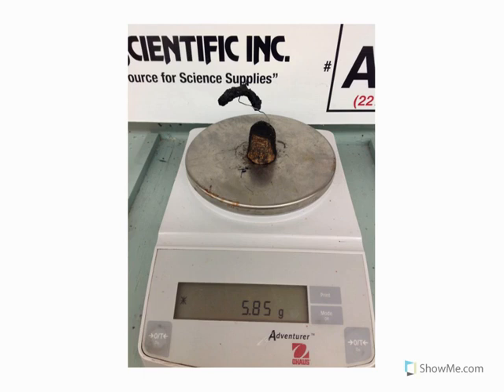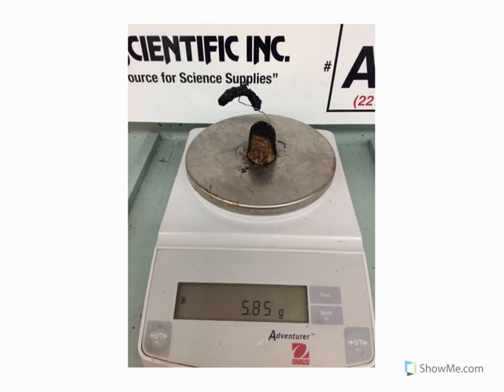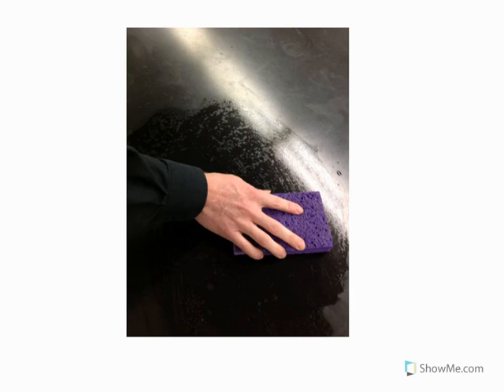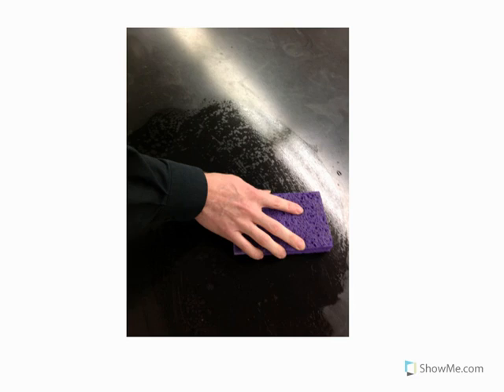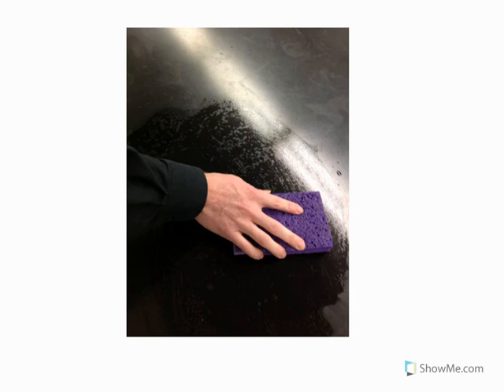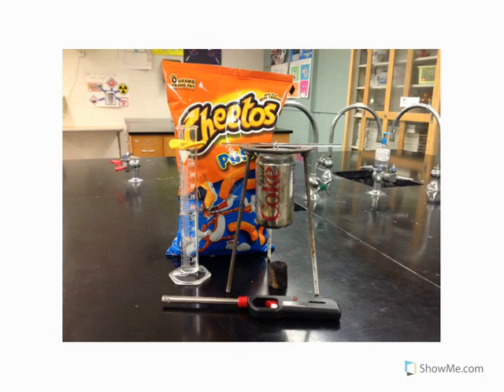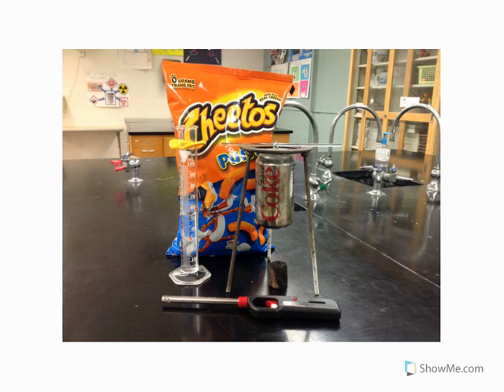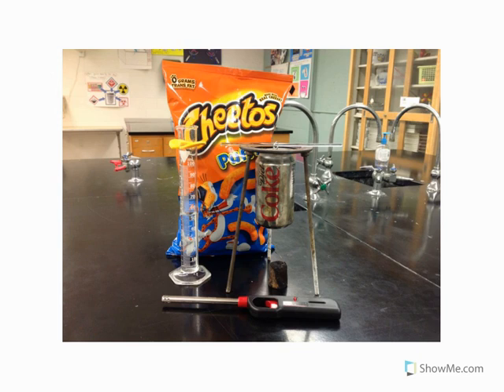Repeat the process with a second Cheeto. Be sure to wipe down your lab table, then rinse off the outside of the can and return it to the box so that it can be reused for other classes. Follow the post-lab procedures as directed by your teacher. Enjoy!